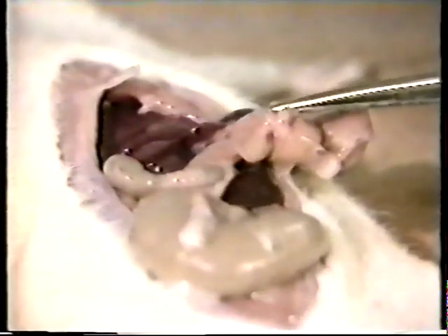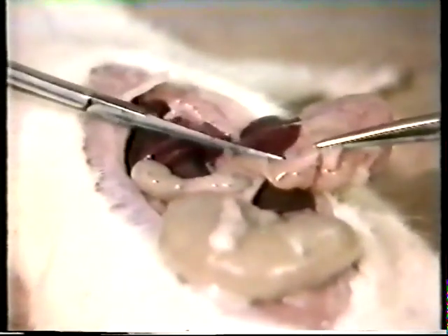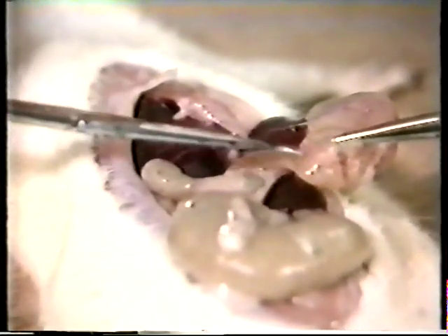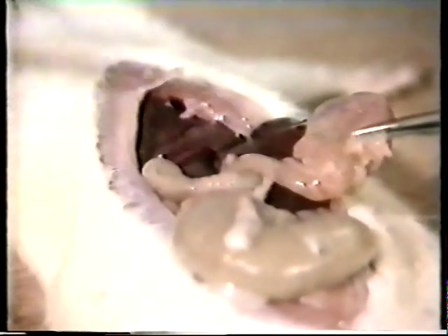This glass slide is not, however, much use in an electron microscope, so I'll have to start with a fresh piece of pancreas. A small piece of tissue is removed from a rat and placed on a wax block. In electron microscopy today, a technique of double fixation is used. The first fixative is glutaraldehyde.